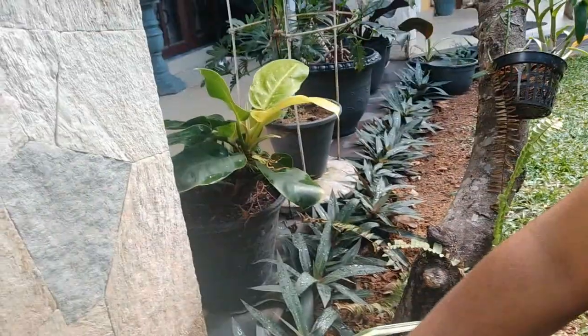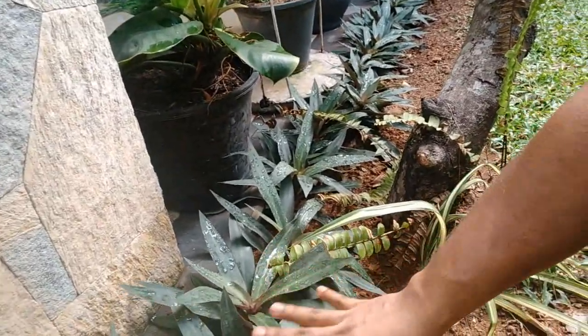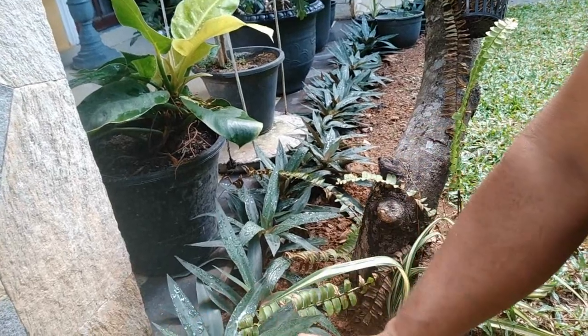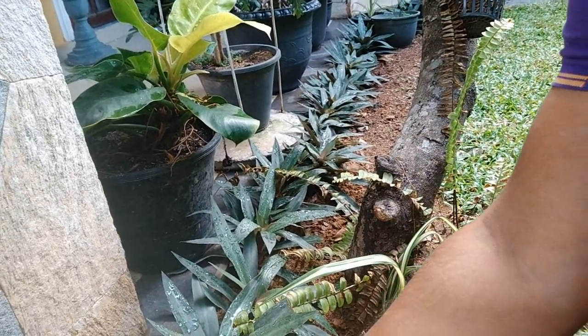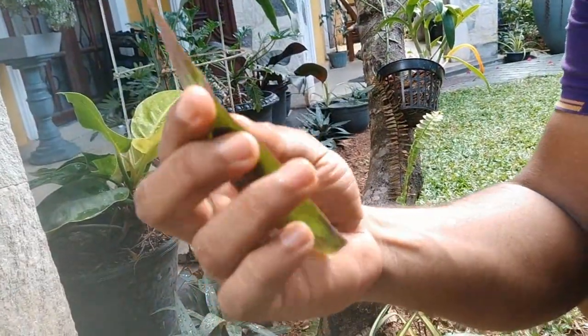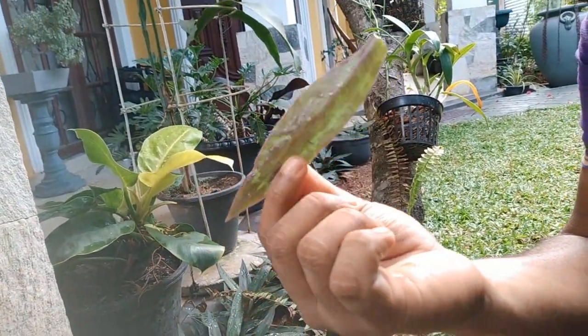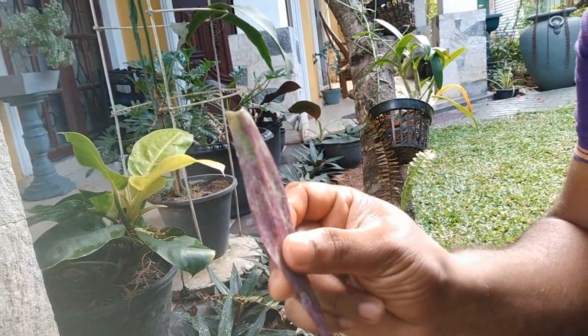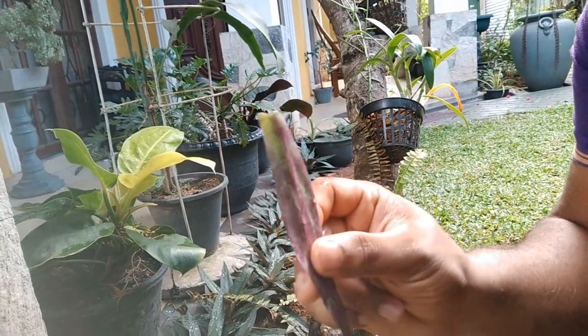So it's a plant, you can see here. In this plant, it's a bushy plant. So what you're going to do, we take a sample from this plant. So we take a matured leaf, we select a matured leaf like this. So you can see the lower epidermis, I mean behind the lower epidermis you can see the purple color stain. So what we're going to do here is we are going to make a sample from this specimen to see the plant cells. Let's go.